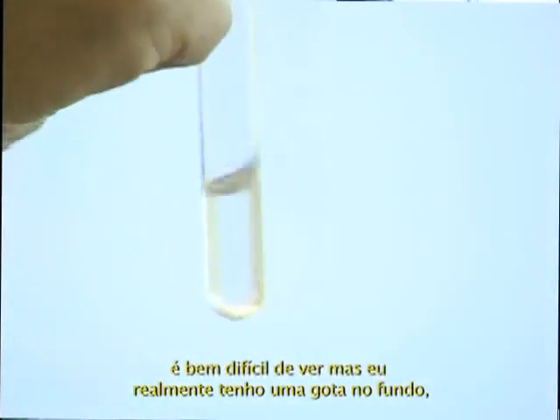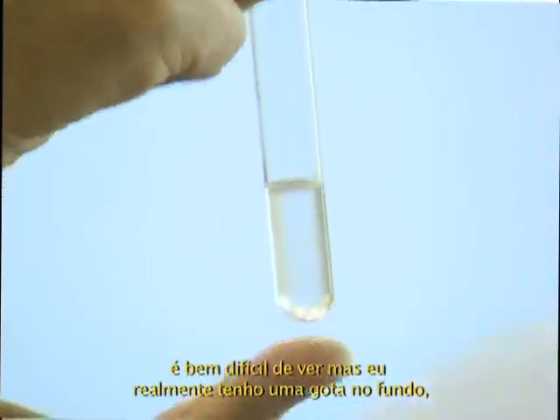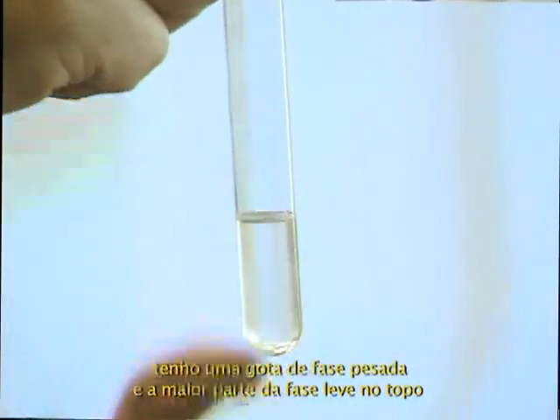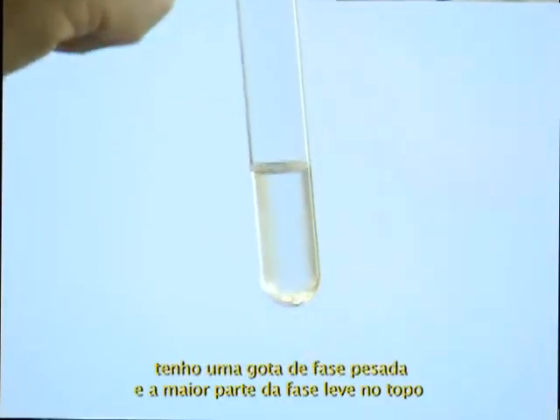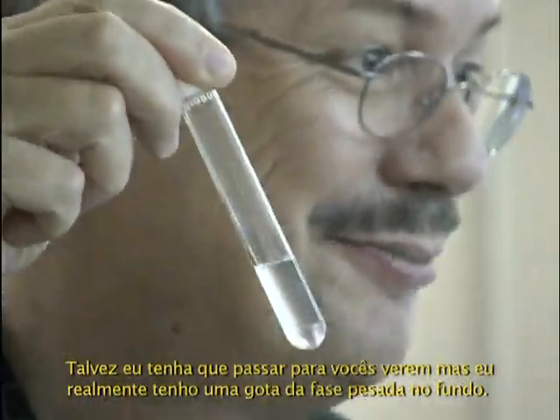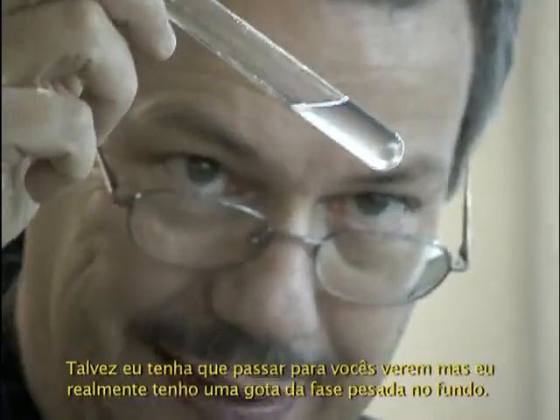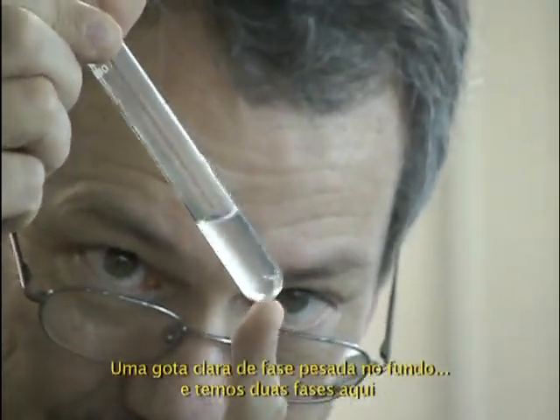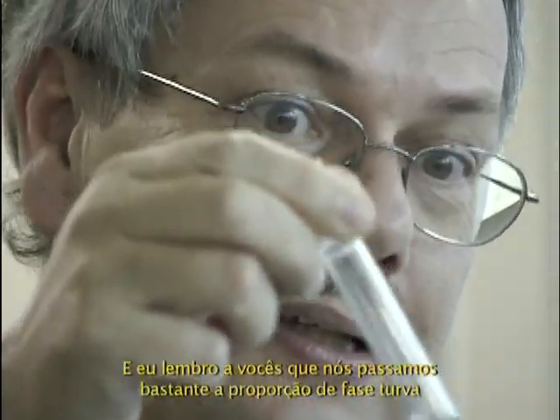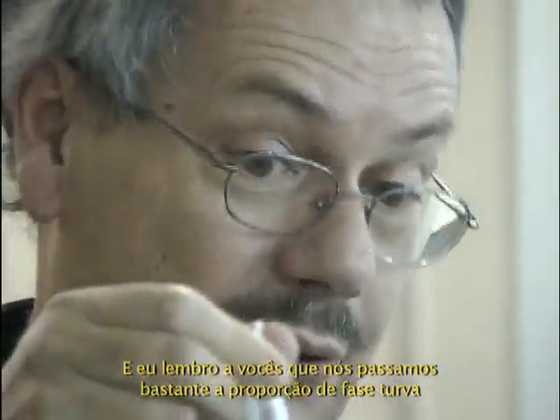It's very difficult to see, but I do have a drop at the bottom. I have a drop of heavy phase, and most of the light phase is on top of it, so you don't see it. I may have to pass the tube to see it. But there is a clear drop of heavy phase at the bottom. So we do have two phases in this one. And I remind you that I passed the cloudy proportion by a lot.